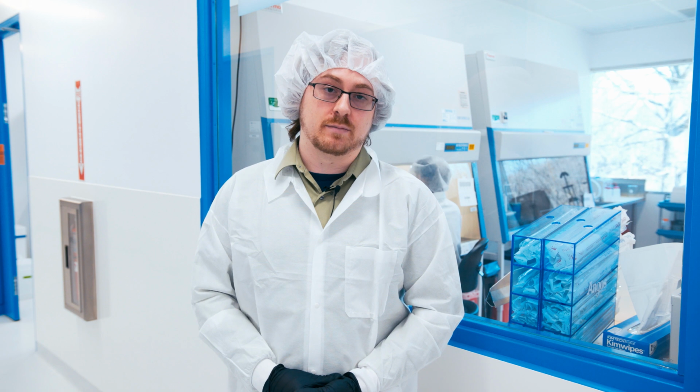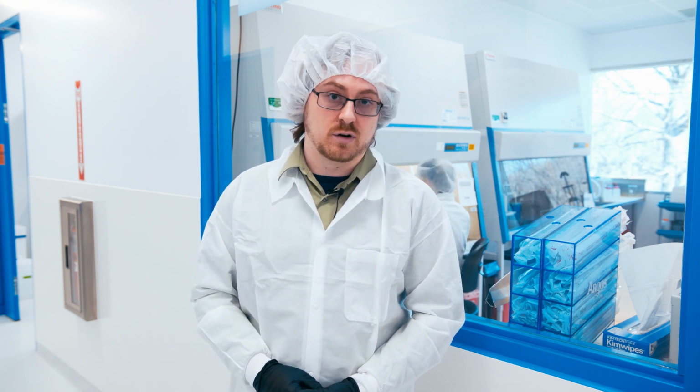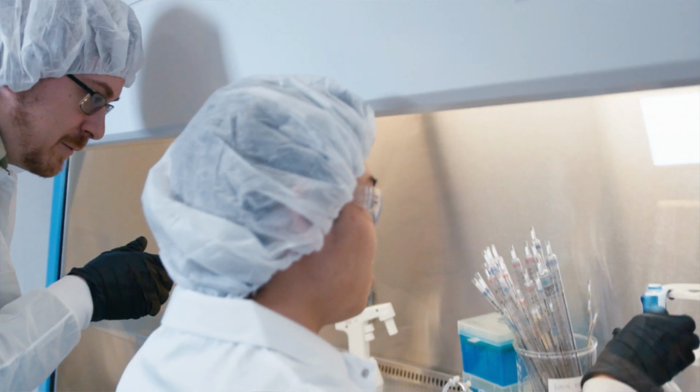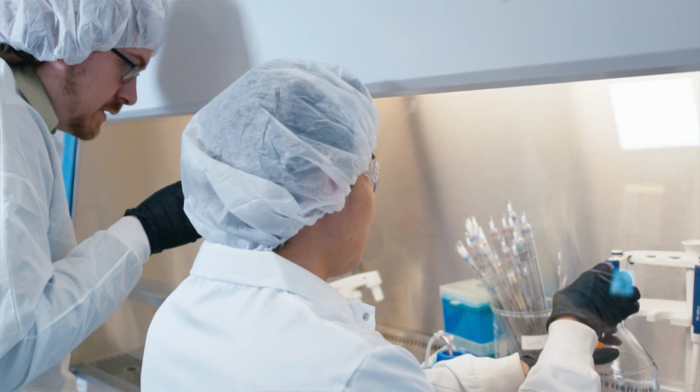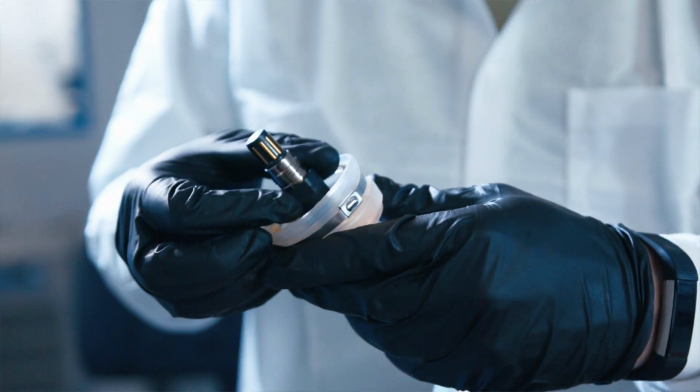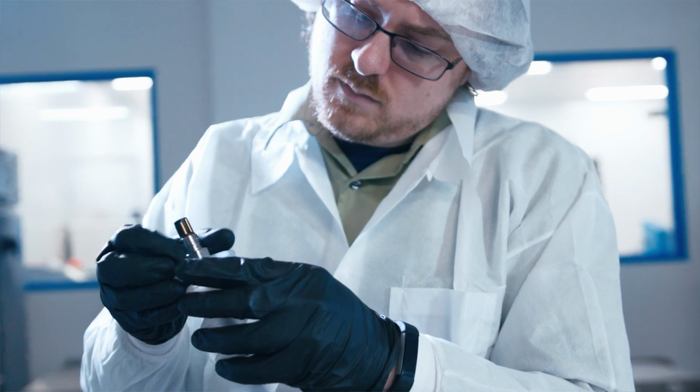In the Introduction to Aseptic Processing course, we teach you to make sure that no foreign substances get into your product. This process includes proper GMP gowning, procedures for handling hazardous liquids, and aseptic connections, as well as proper PPE, following standard operating protocols and batch records as per industry standard.